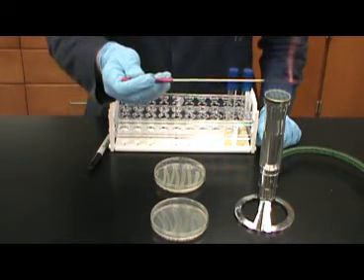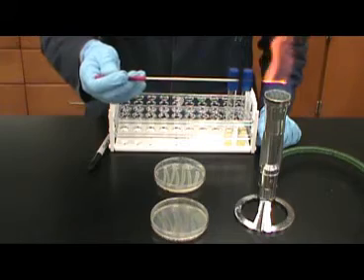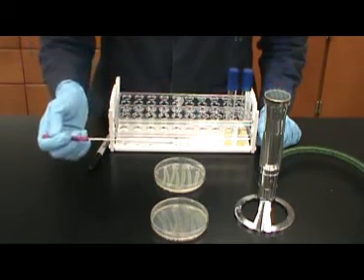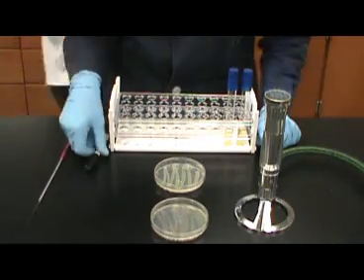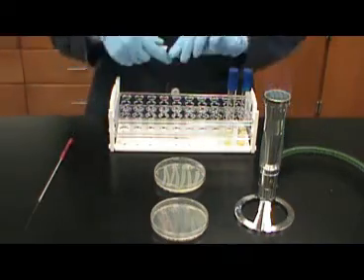Once you have completed inoculation of the tubes, make sure that they are labeled with which bacteria is in each one. Then place them into the incubator in preparation for the next lab period.